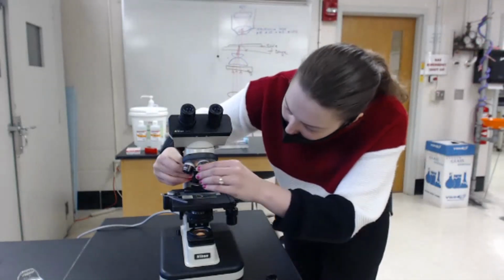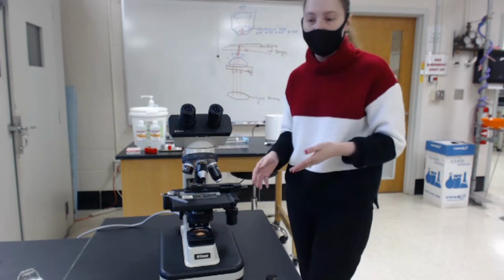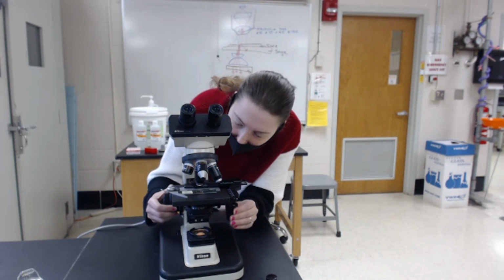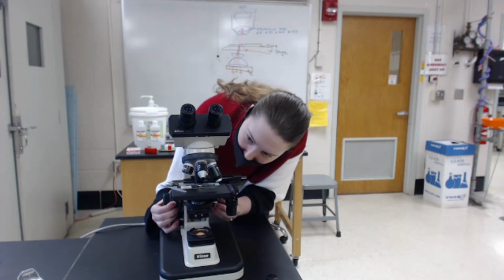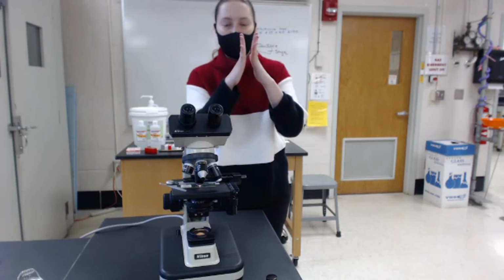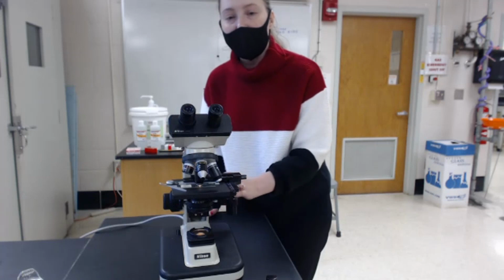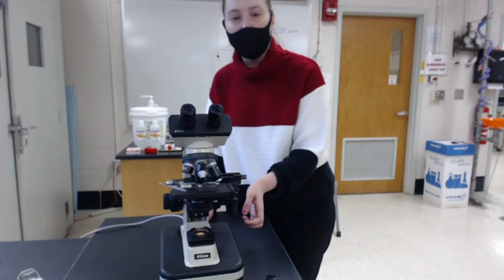Next, I will swivel the oil immersion lens over, and this is the one with the white stripe for our samples. Then, obviously this is backwards, normally you would be facing the microscope, but I'll bring the slide up to its level and make sure that the oil is actually connecting to the lens. You'll see it go from a dome shape to kind of an hourglass shape when it connects the slide and the lens together. From there, I would view the sample and use the coarse focus a fraction of a bit to move the image in place, and then the fine focus to make it nice.